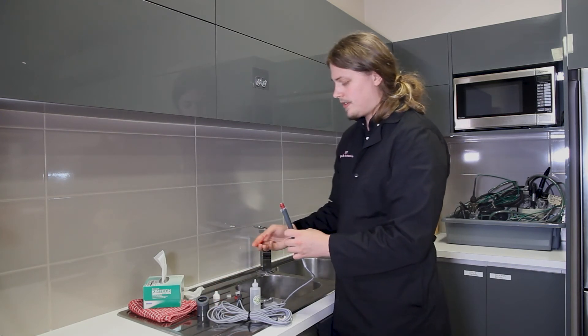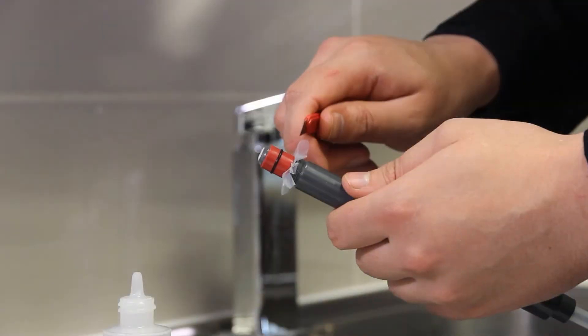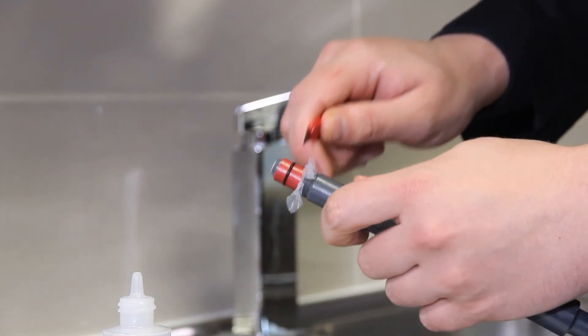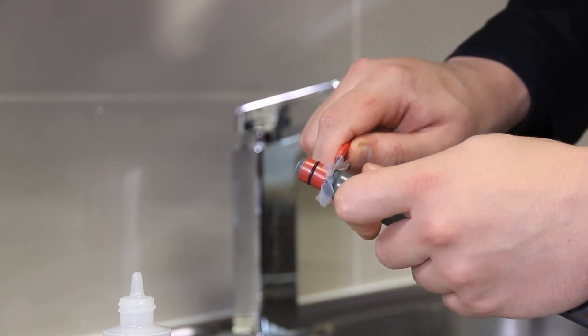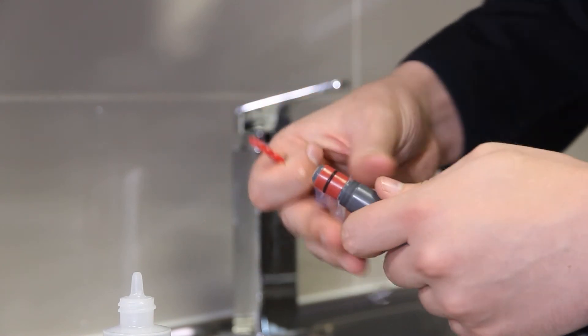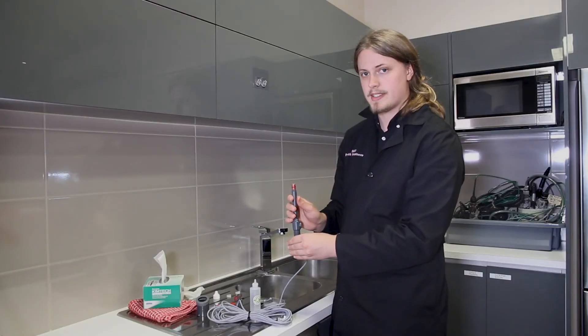Next, grab a small box cutter (one is included with the kit) and slowly cut away all the excess membrane at the bottom of the two red rings. This should leave you with a nice clean sensor tip.